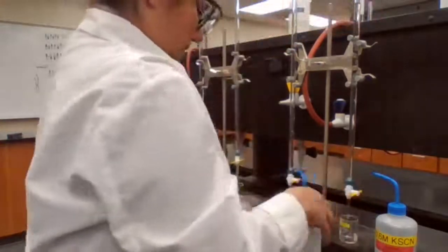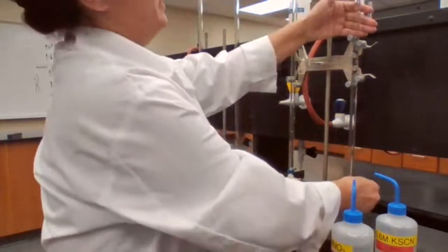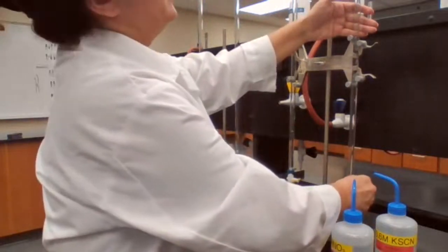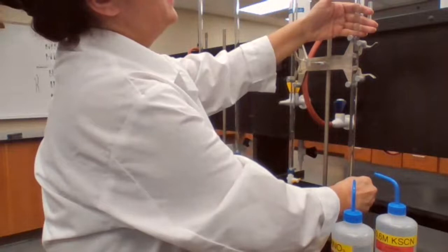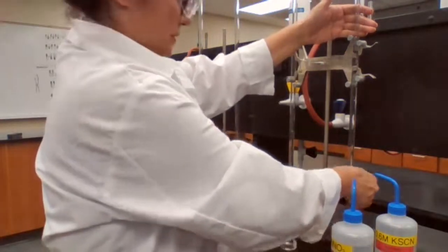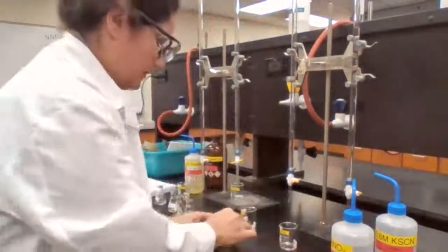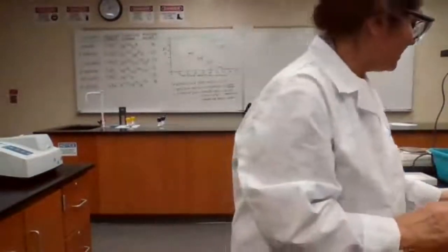Set at 15, go to 20. Okay, 20. We have 5 minutes for B to be ready. Just setting up for 5 minutes.